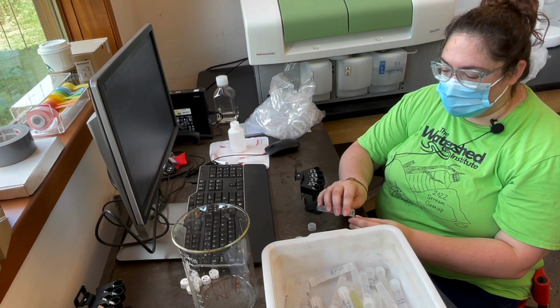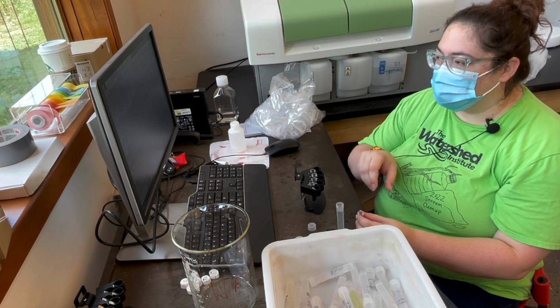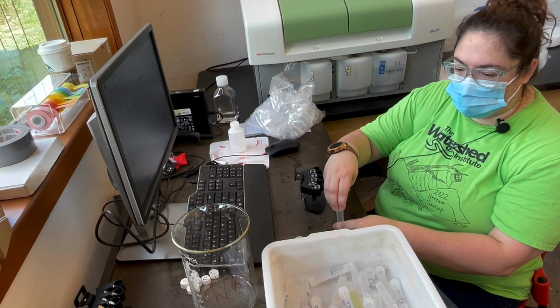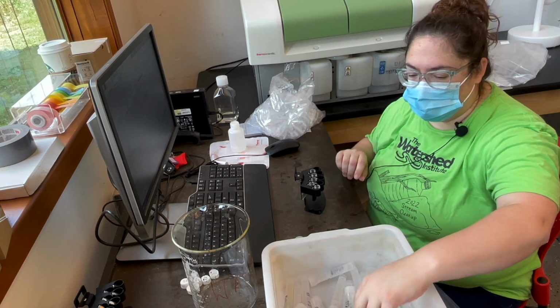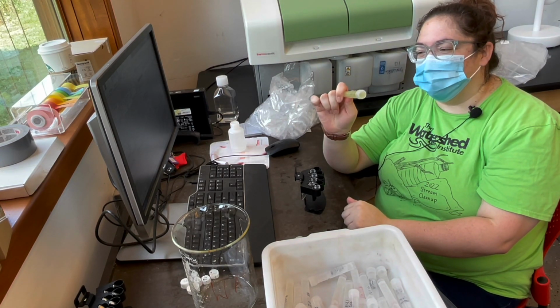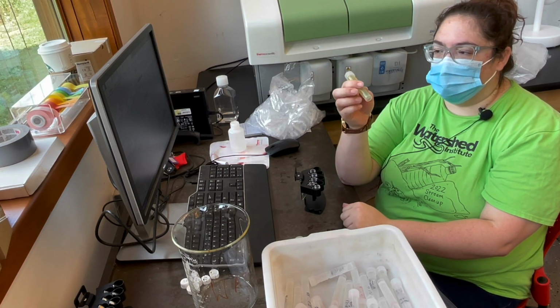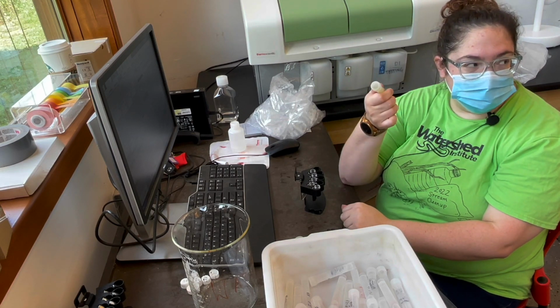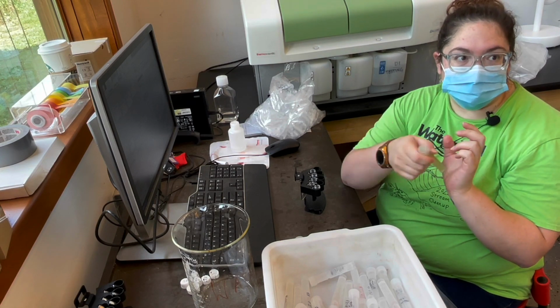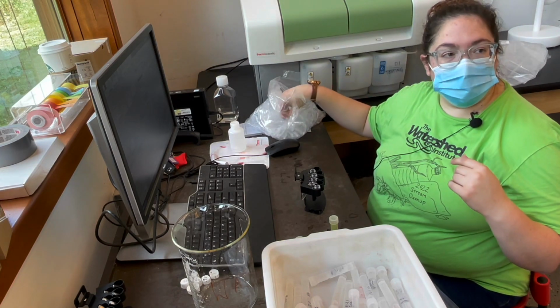But mostly now what we're finding is harmful algal blooms, and that's a newer issue that we've been having. So when you get water samples that look like this, see how green this one is? That's a pretty good indication that we've got an algal bloom happening. And these algae can produce toxins that can be harmful to humans as well. So that's another thing that we're measuring. Okay. And that's one of the things that you guys look for in your visual assessments when you go out.